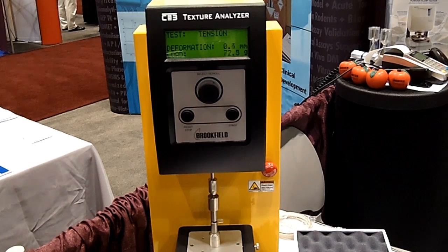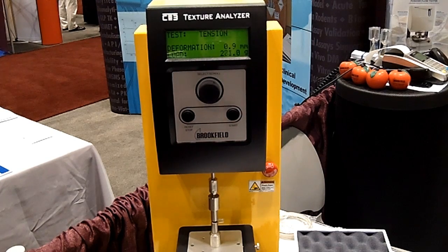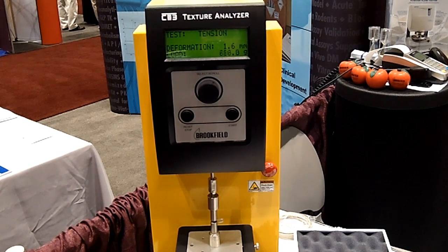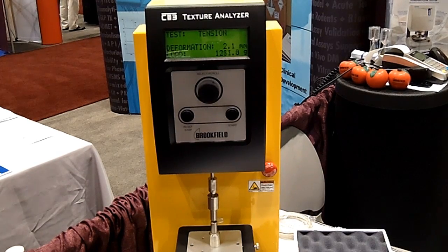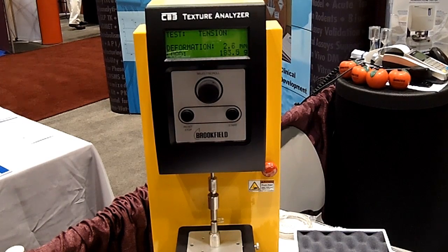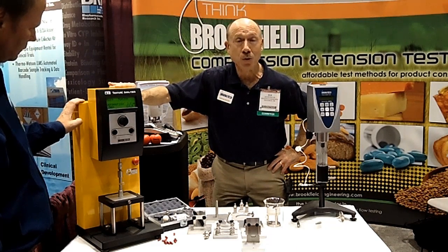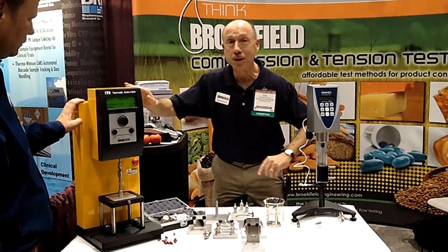Dave has now started the test and the two tines are starting to pull apart. As they pull apart, you can see that the force level is increasing, which means there is more and more stress building up in the wall of the capsule. The capsule is starting to stretch and to deform — and it just fractured. You heard a little noise, perhaps you didn't, but we could hear it up here, and the capsule physically split apart.